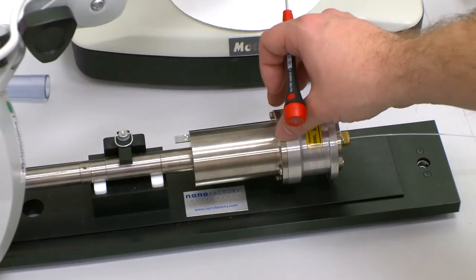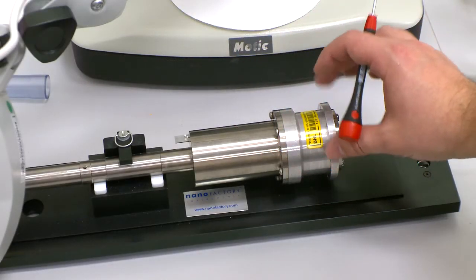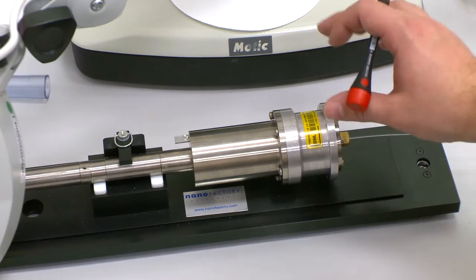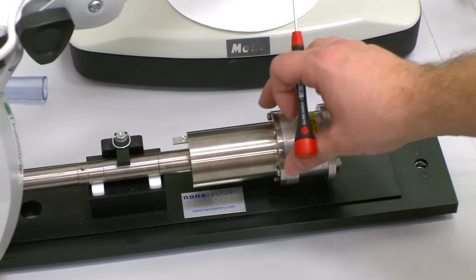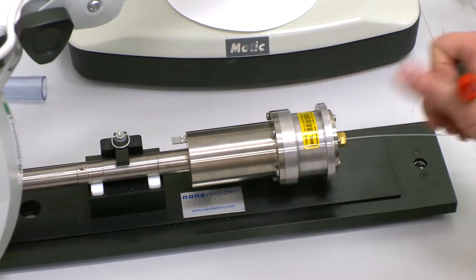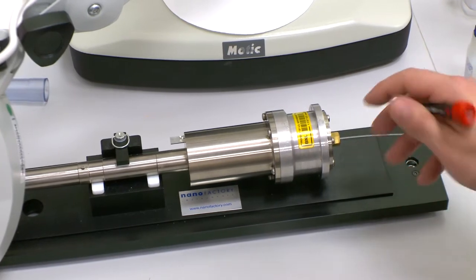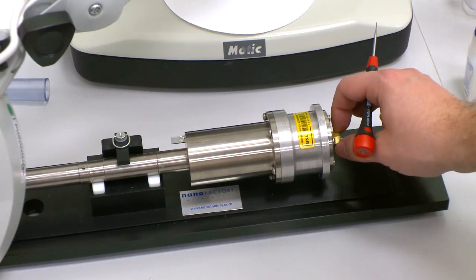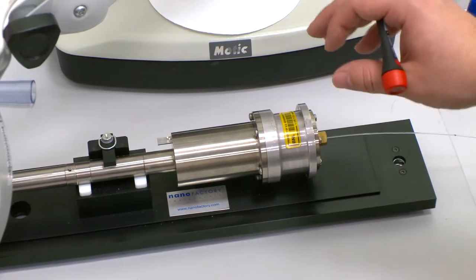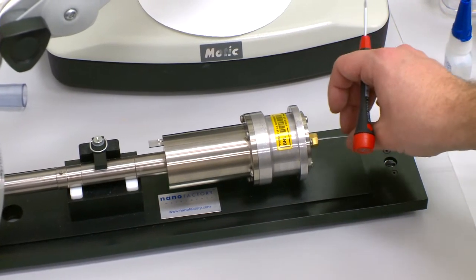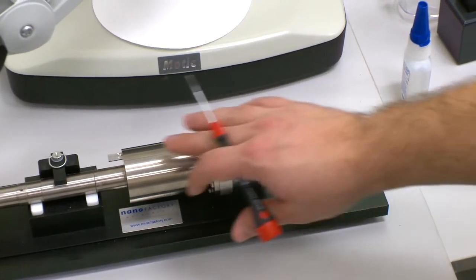So the optical fiber from the laser control module runs into the body module of the microscope sample stage through here. This is a Teflon ferrule that provides a vacuum seal between the outside world where the fiber comes in and the light channels that run down the body of the microscope.